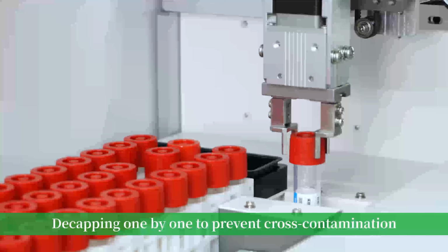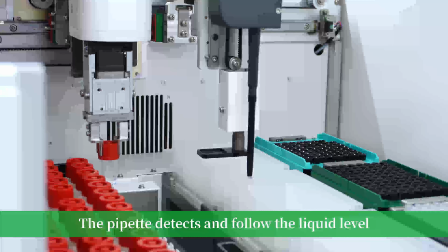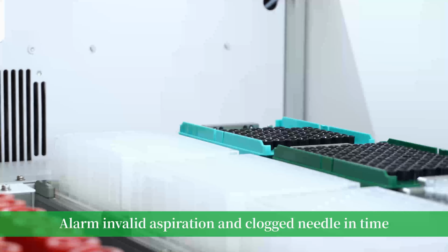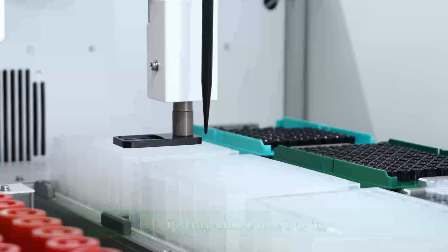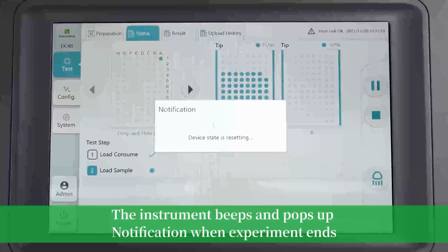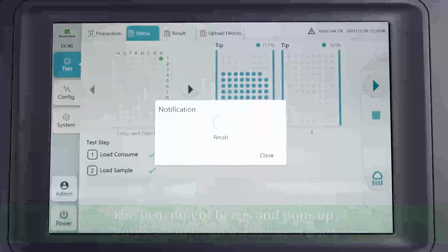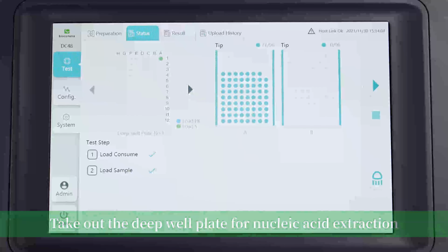Decapping one by one to prevent cross-contamination. The pipette detects and follows the liquid level. Alarm invalid aspiration and clogged needle in time. The drip tray under the pipette effectively prevents cross-contamination. The instrument beeps and pops up notification when experiment ends. Take out the deep well plate for nucleic acid extraction.